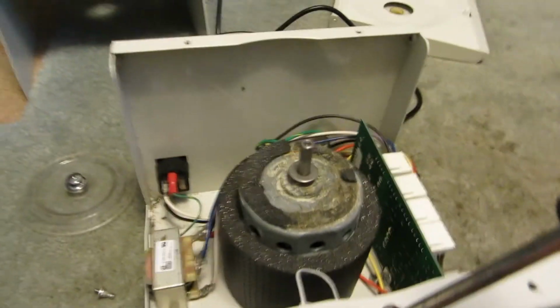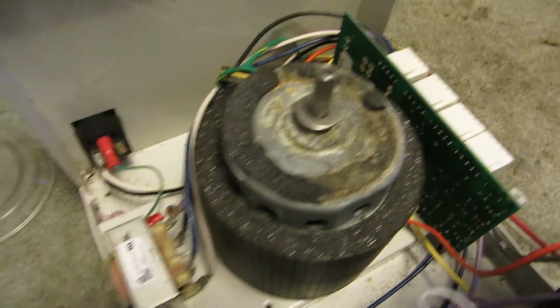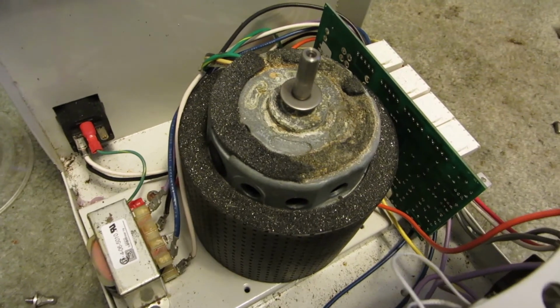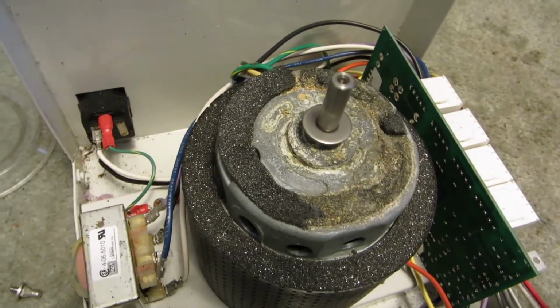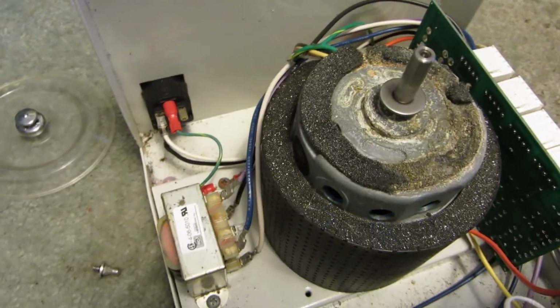So there's really not all that much to a centrifuge. Still a cool piece of technology, but not really that much to it.